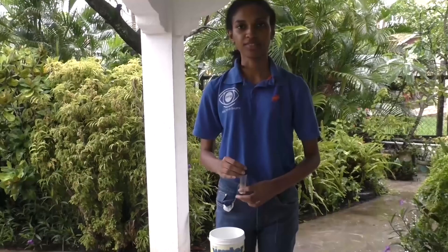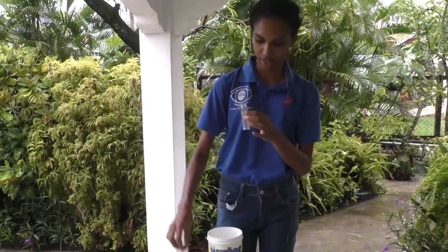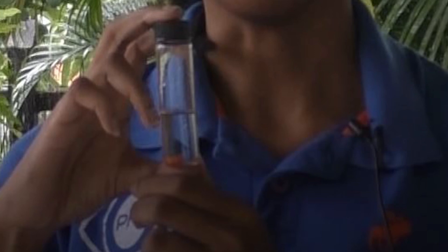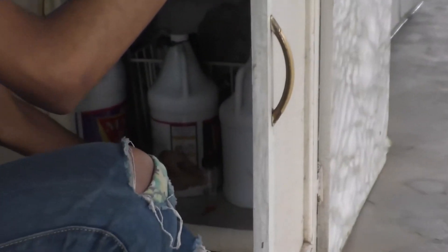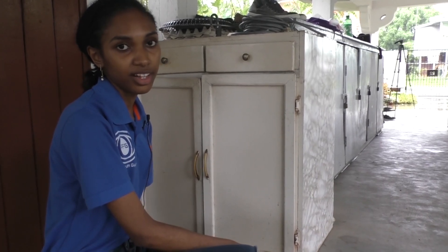We are now going to test for coliform bacteria. Fill the test tube up to the 10 ml mark using sample water, then cover it with the cap. The tablet is at the bottom of the test tube. Place the test tube in a location away from direct sunlight and leave it for 48 hours. Do not disturb the test tube until the 2 days are up, or your results will be incorrect.